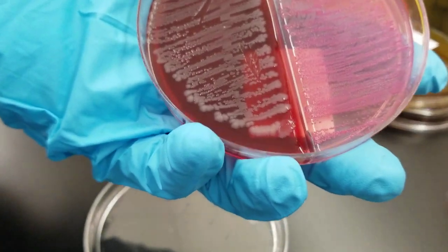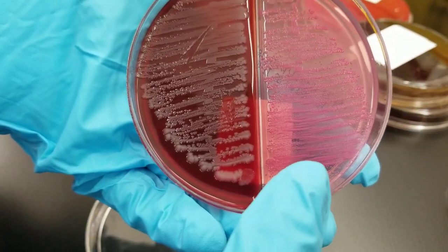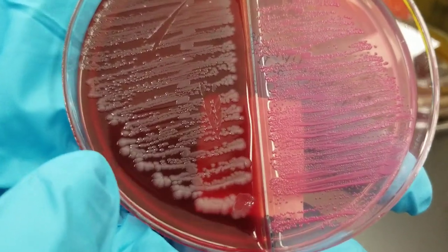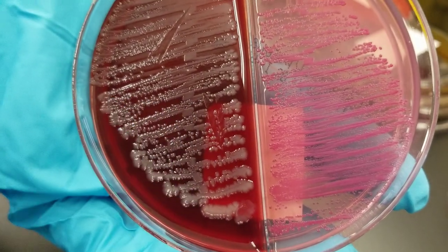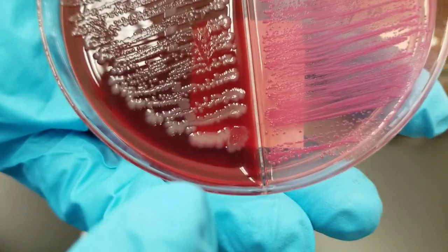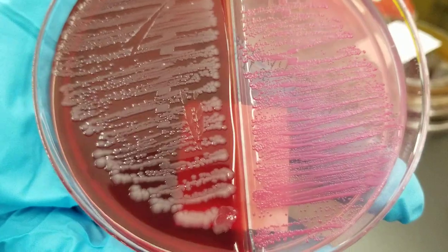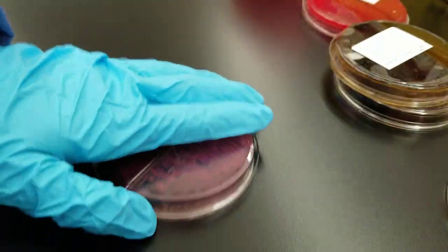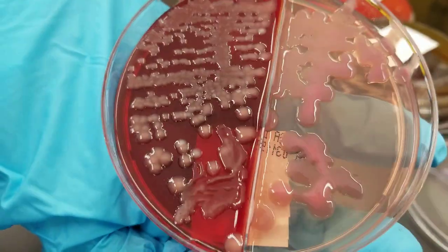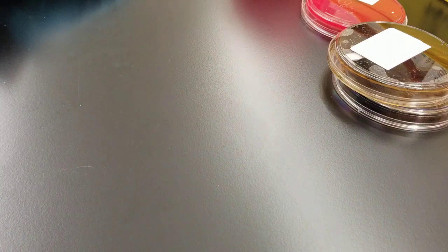This one also looks like it's part of Enterobacteriaceae. We have a lactose fermenter on the MacConkey agar plate. We have very indicative GNR colonies on this blood agar plate because of that scallopy-looking edge — that's very typical of them. It looks nice and wet, but nothing like the mucoidy-looking colonies we saw earlier. So those are some pathogens in the urinary tract.